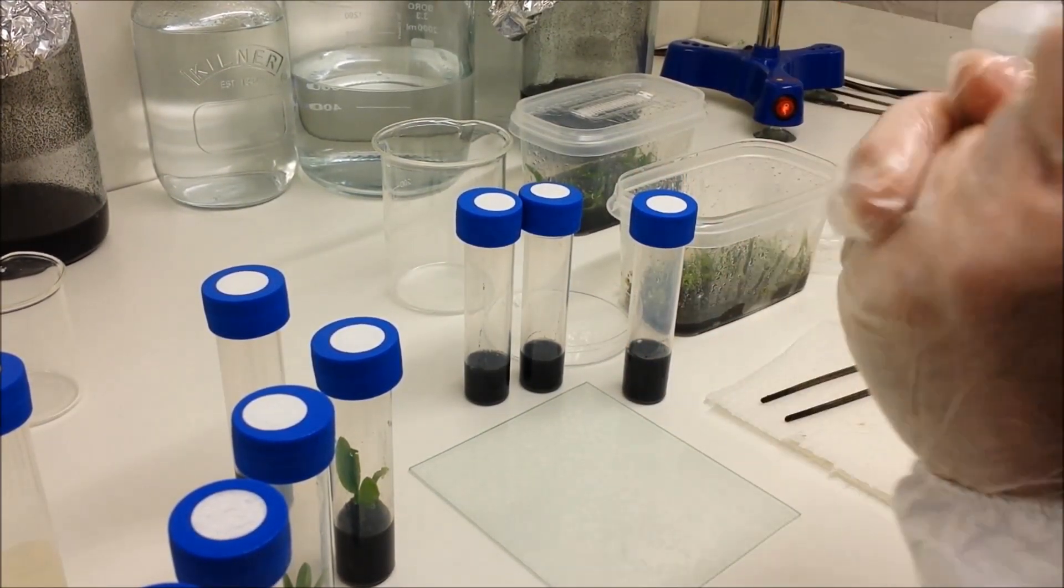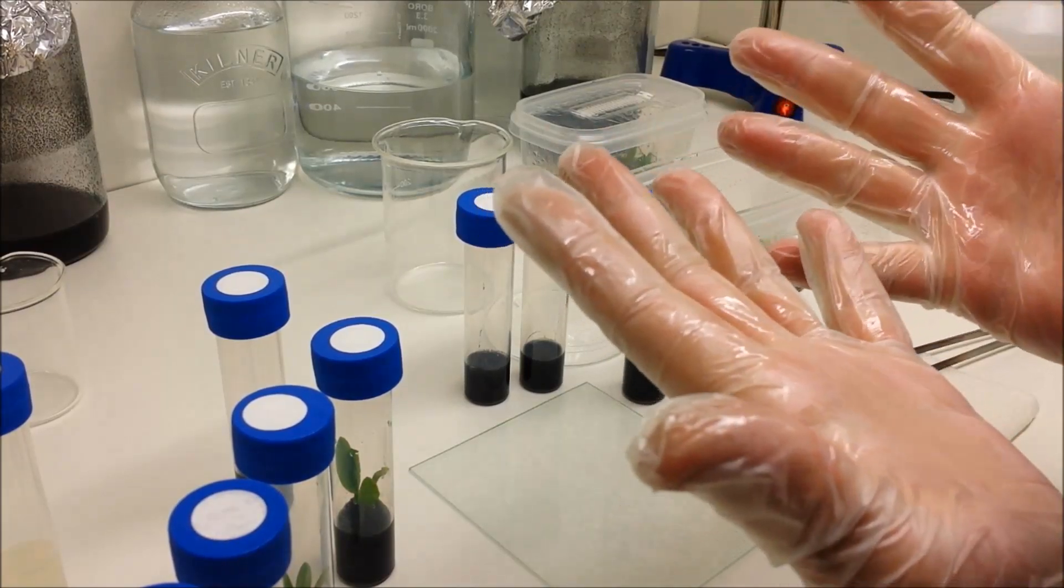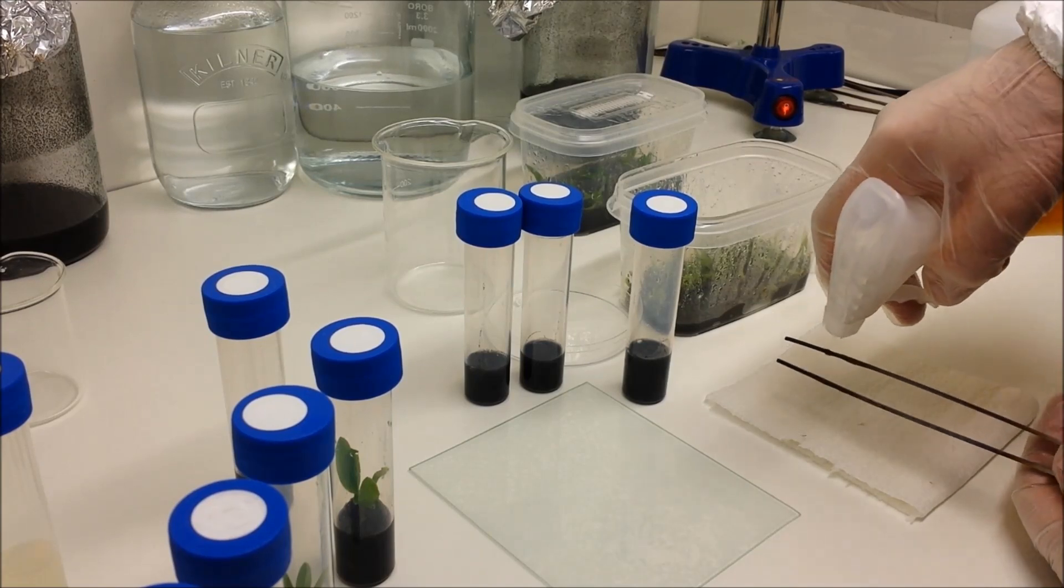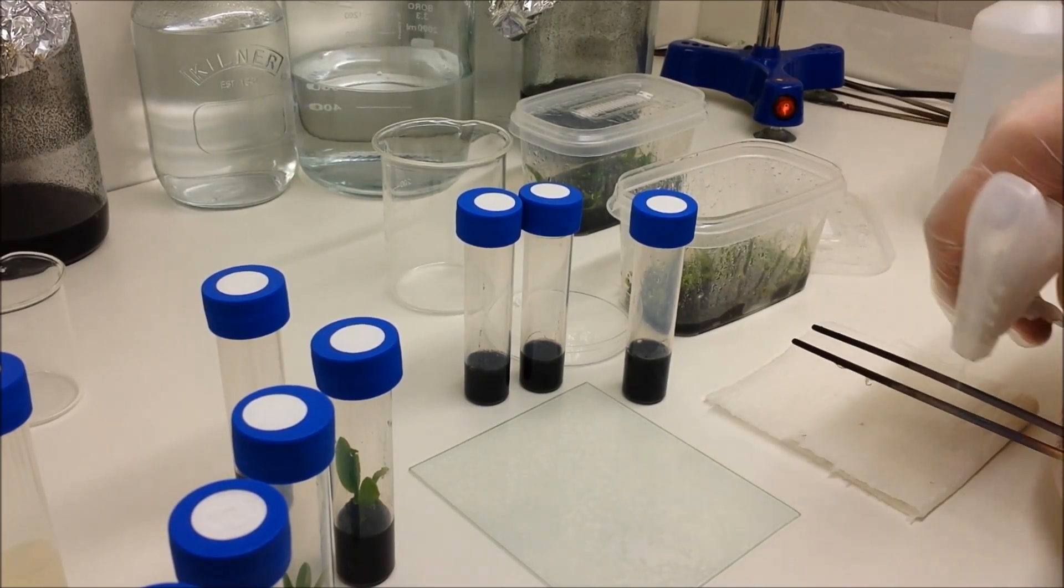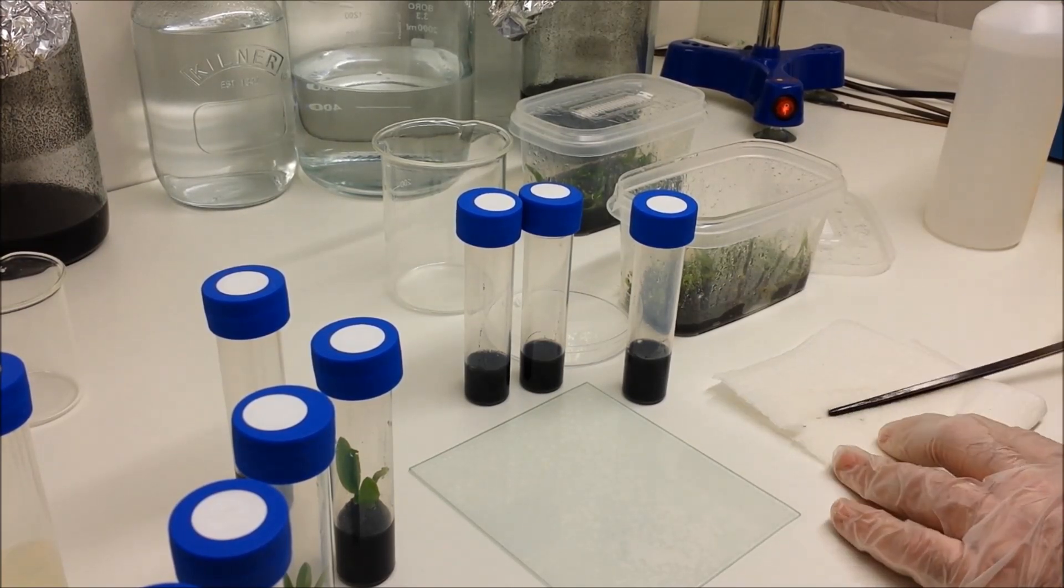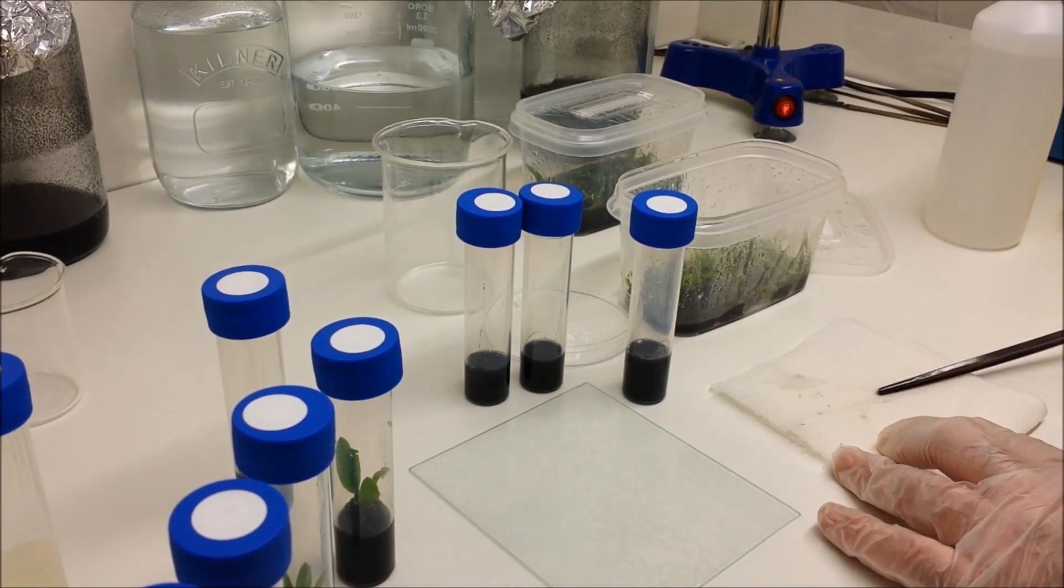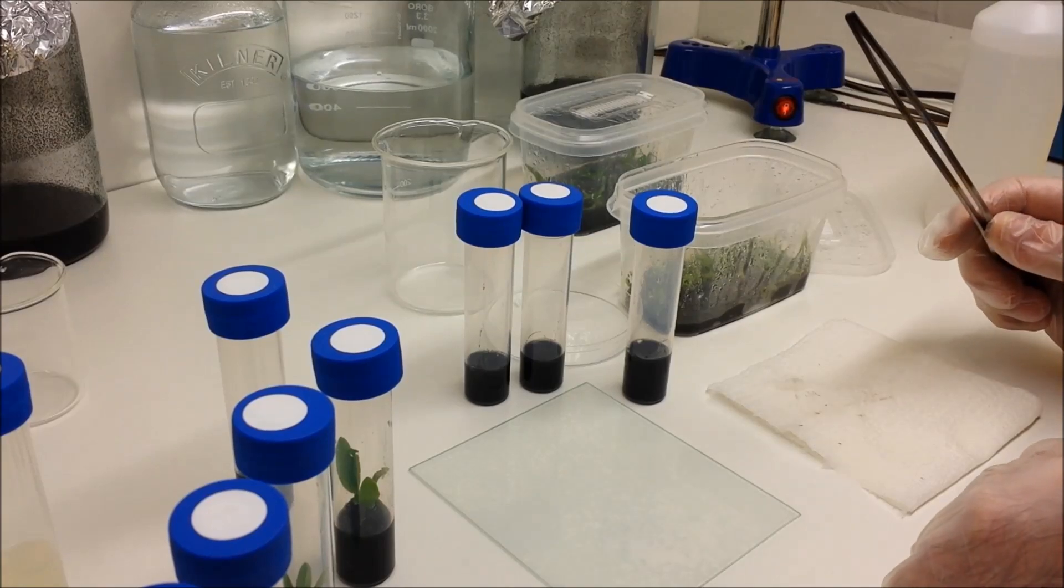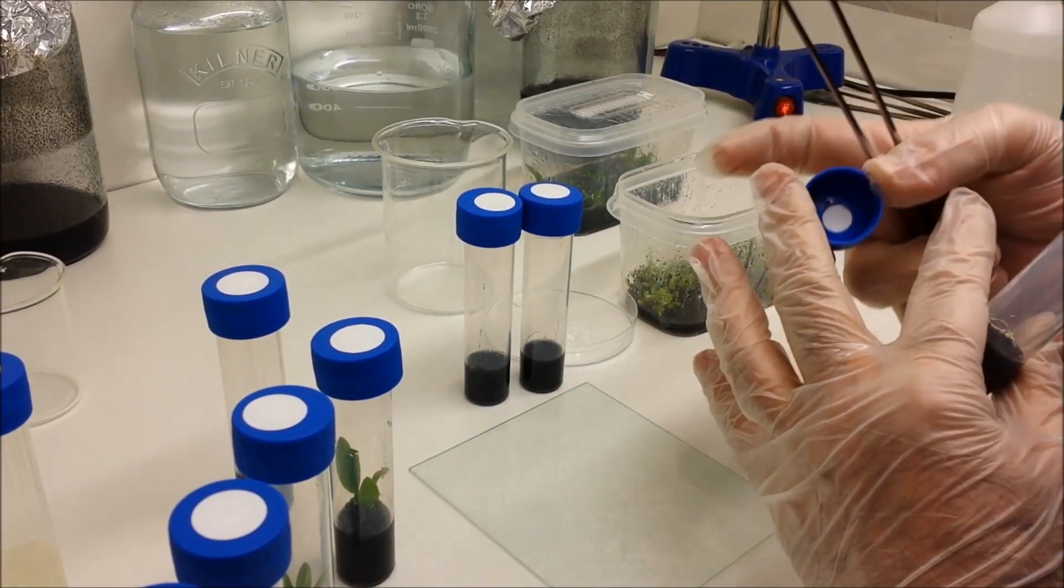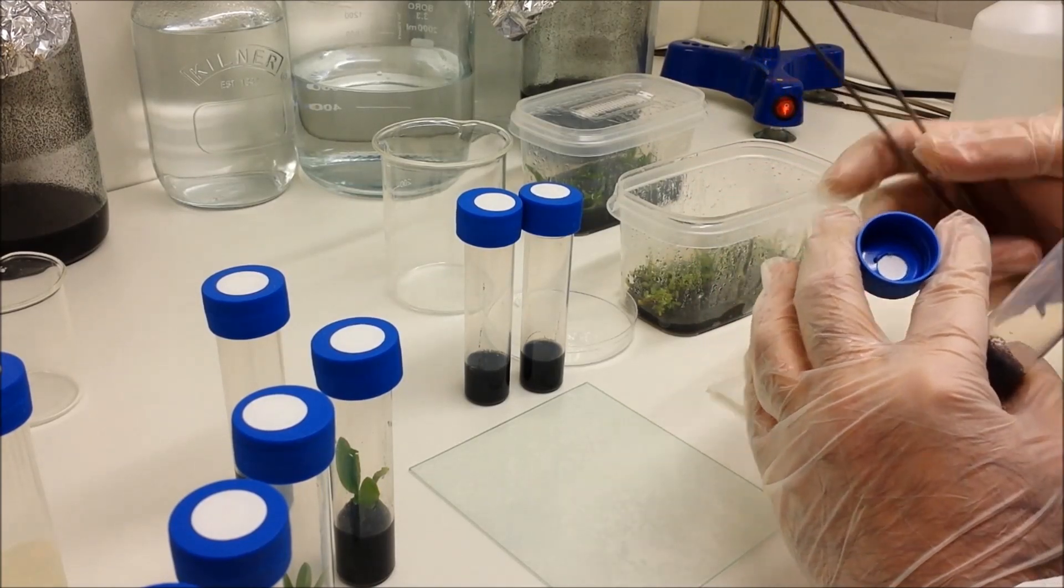Sterilize the hands again. And I'm also going to sterilize the forceps because we've been in one jar with them. I'm spraying with IPA and we're going to give them a wipe on the sterile paper towel so there's no contaminants on them. So again, remove the top between the fingers.